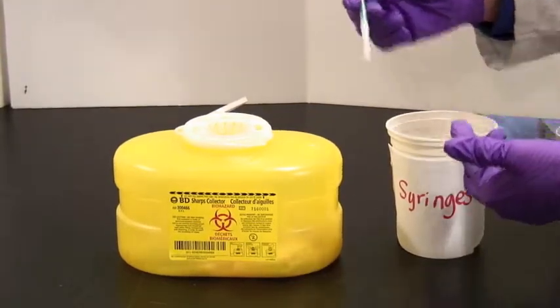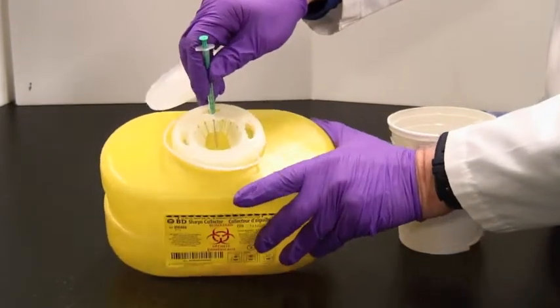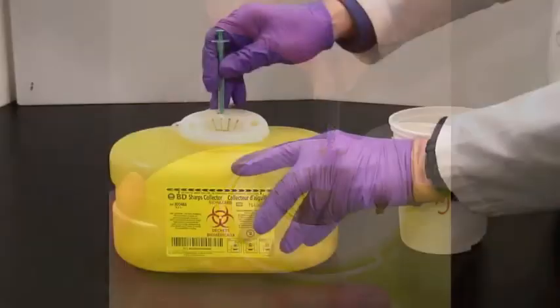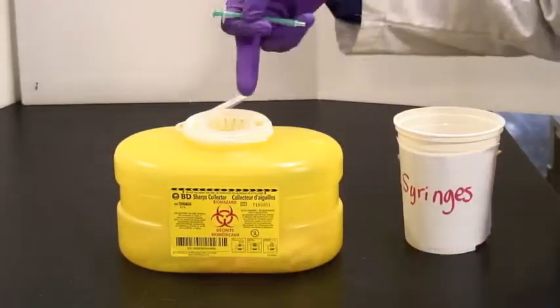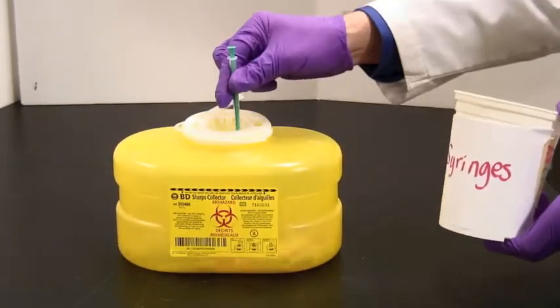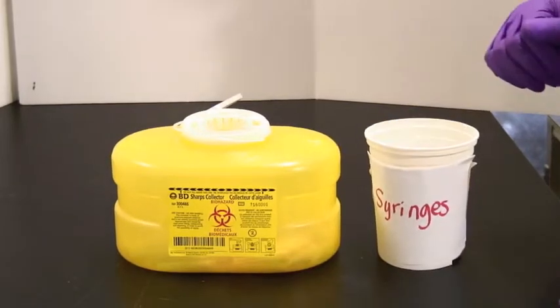If you don't want to be pulling at it, that's fine too. Put the needle and syringe into the keyhole here, and just pop it up like that. The needle goes into the sharps container. The syringe itself does not go in there. It goes into the bucket right next to it, labeled for syringes.